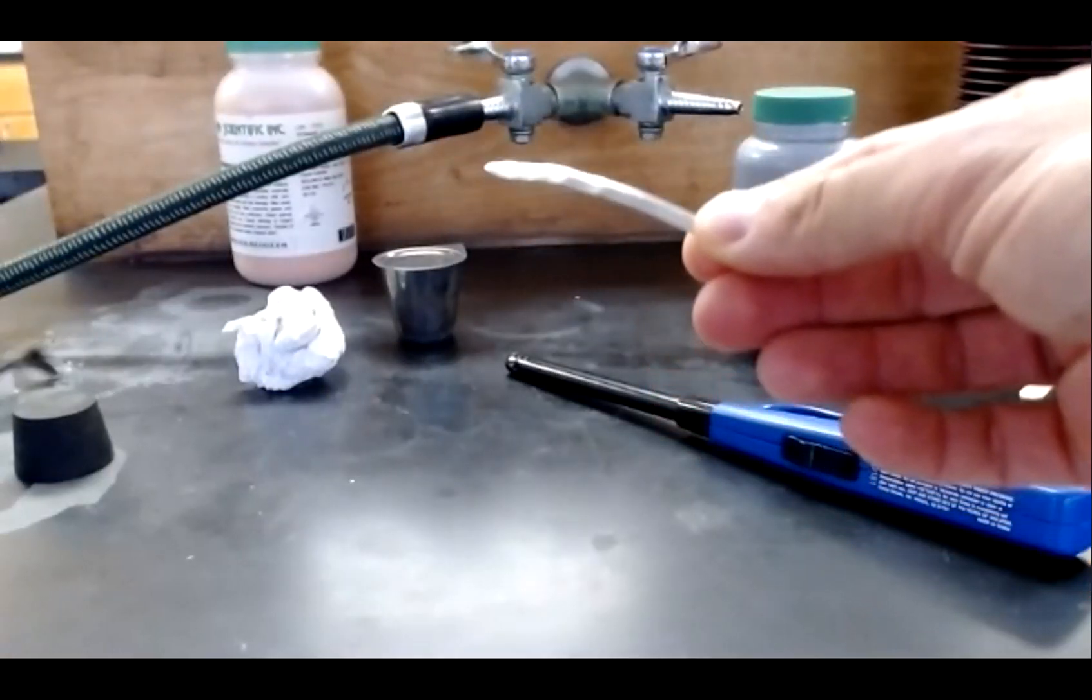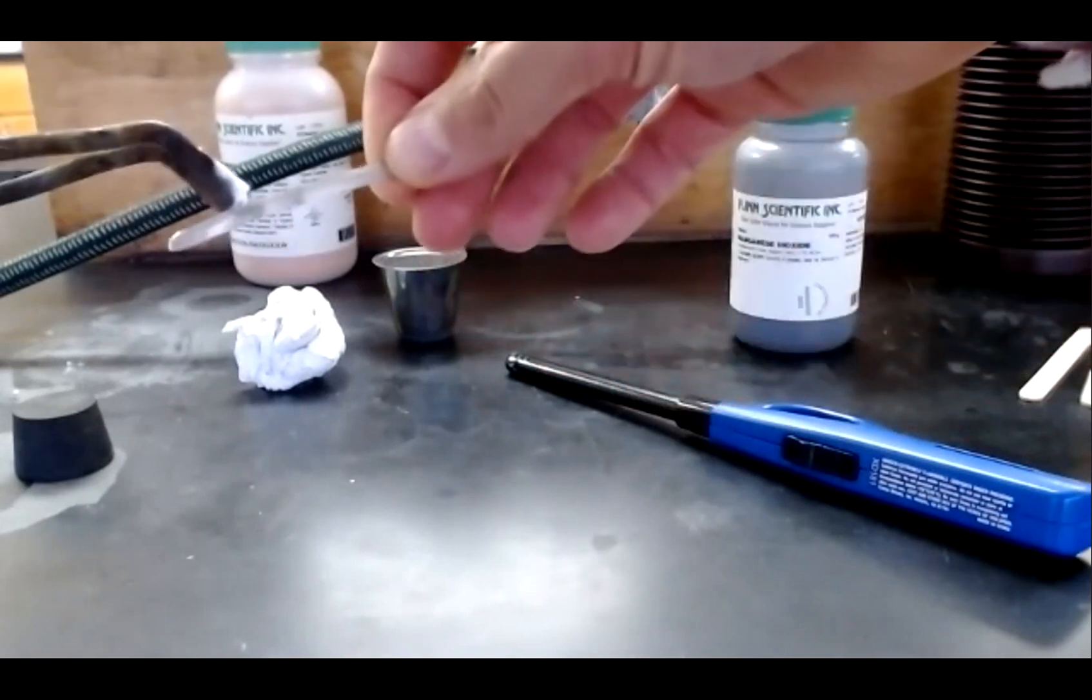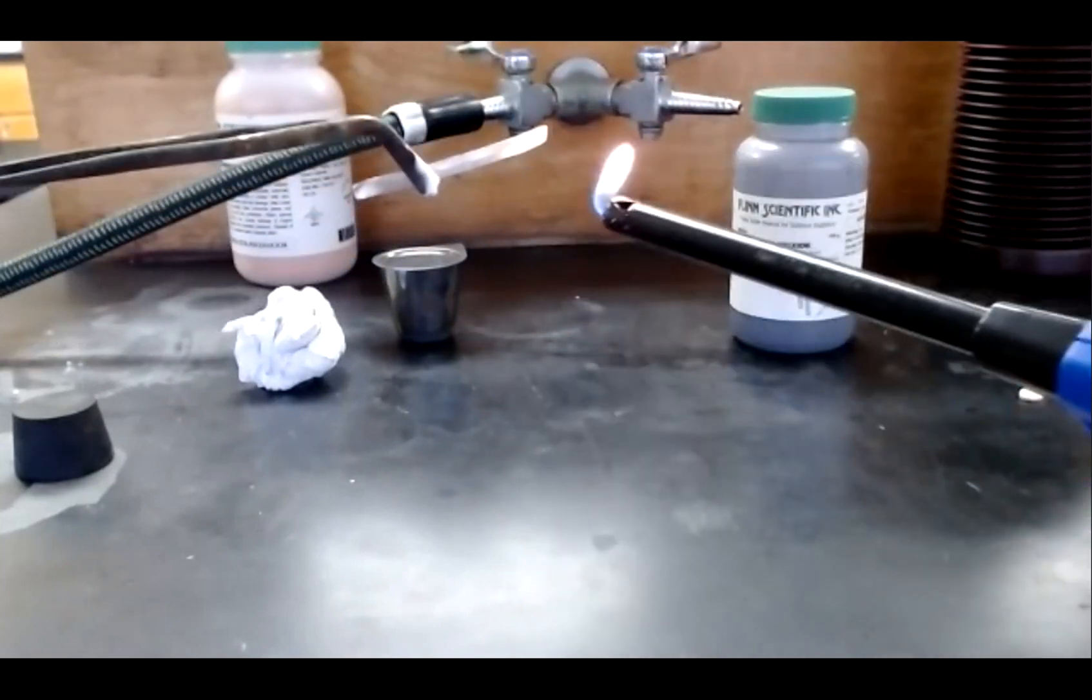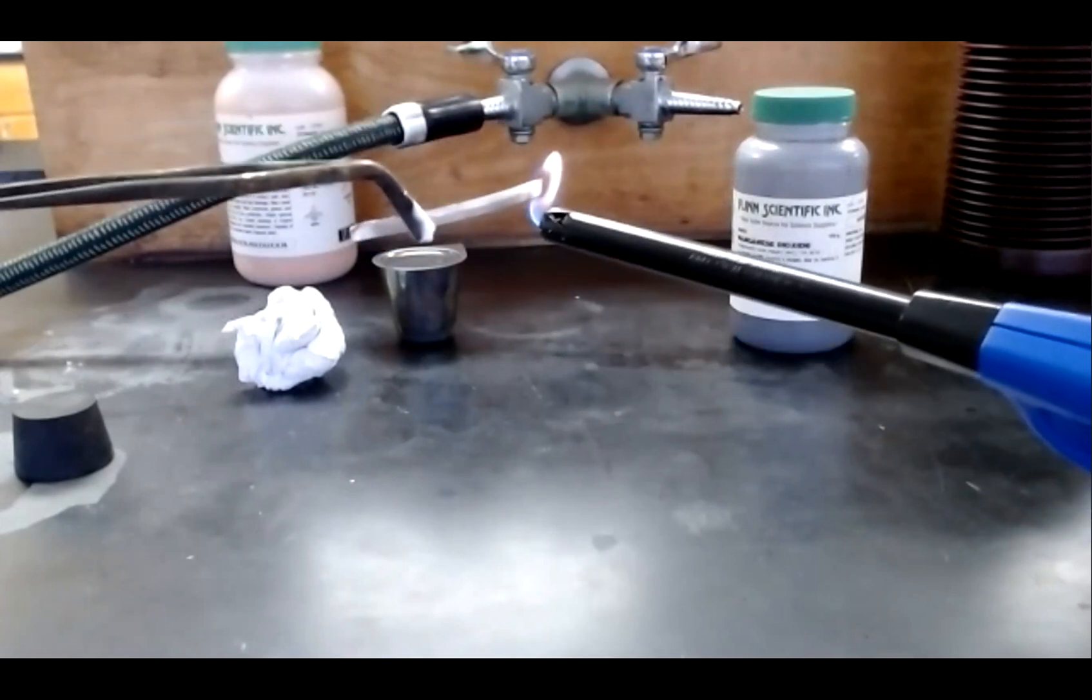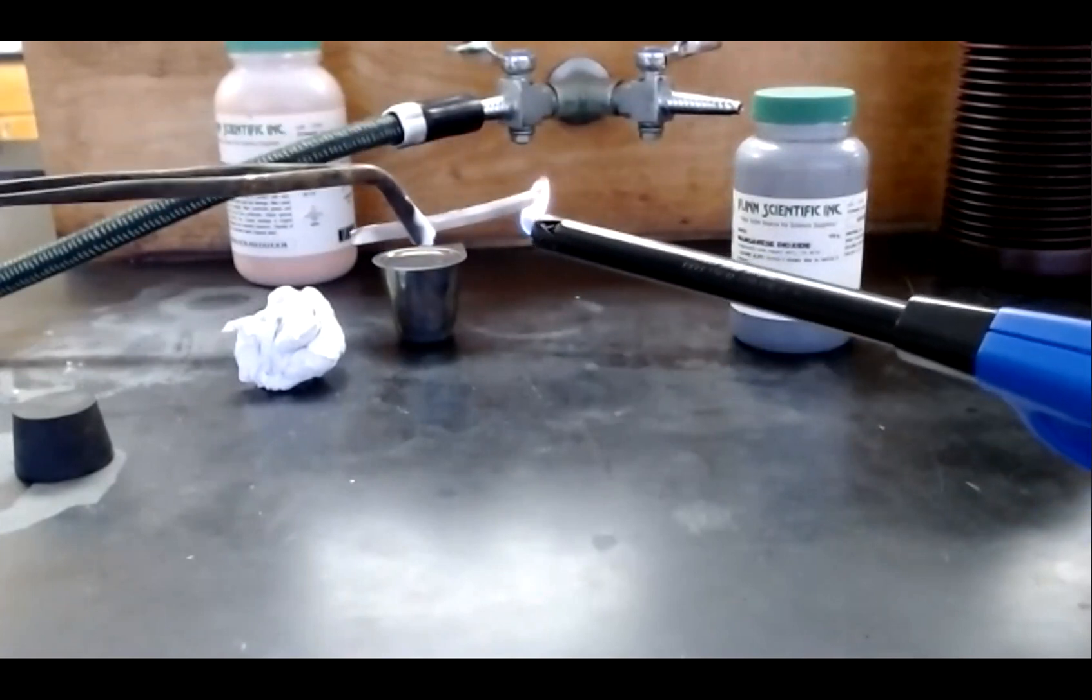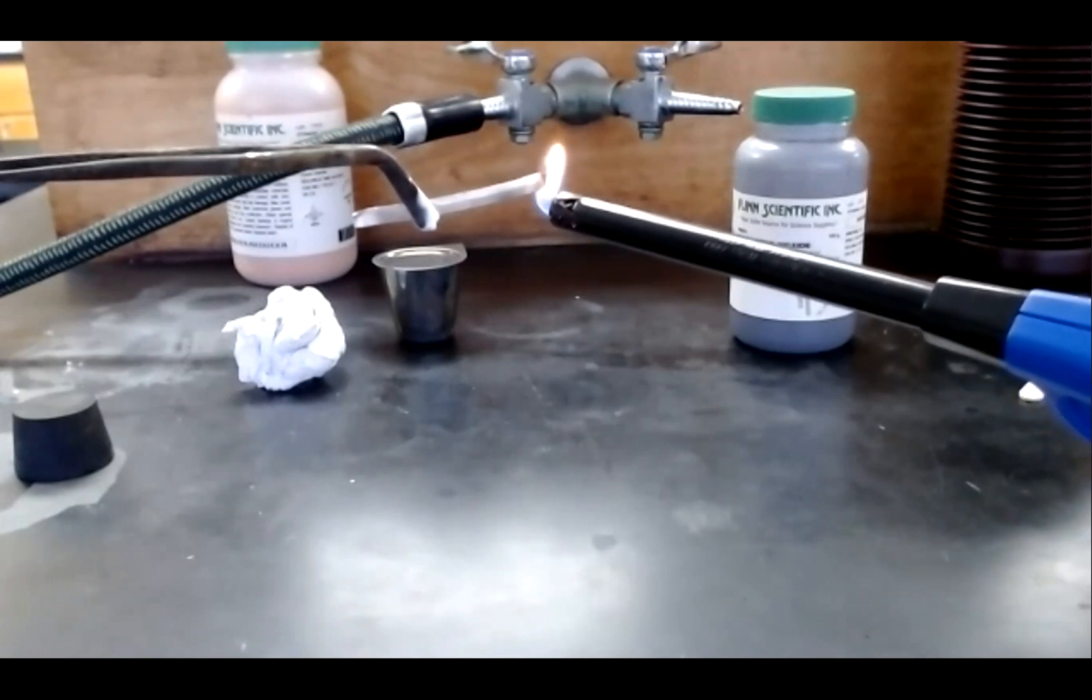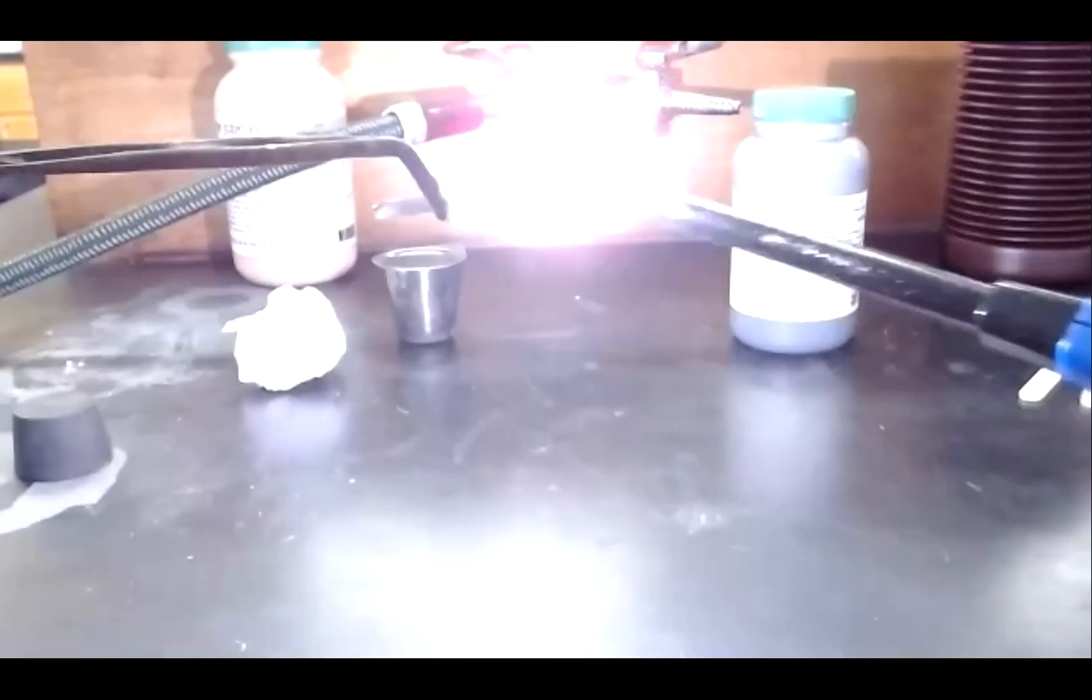Here you can see the example of magnesium metal. I'm going to hold it with these crucible tongs and heat it because it'll get quite hot. Heating the reaction will provide the energy needed to start what is going to turn out to be a very exothermic reaction.